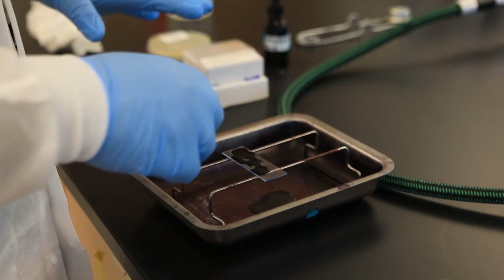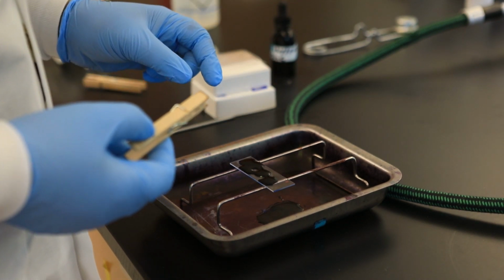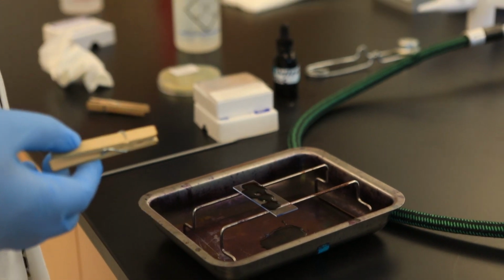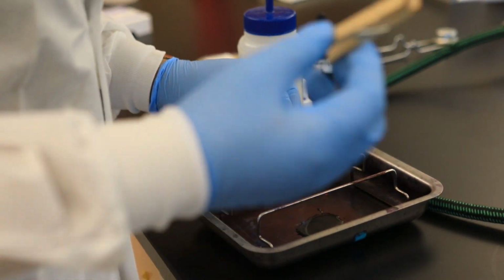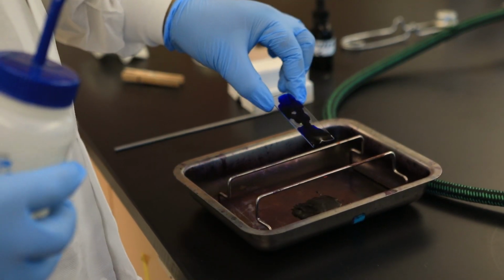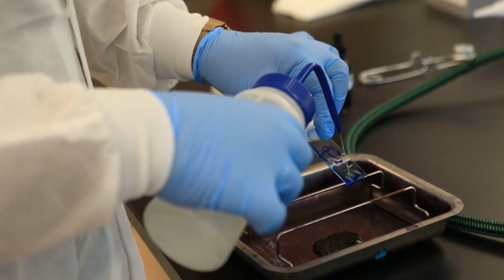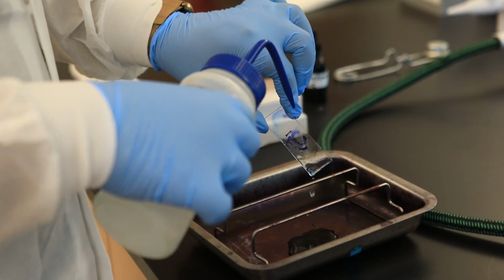So once the 60 seconds, or if you leave it on for 30 seconds, the time is up, what you're gonna do next is that you're gonna wash or rinse the slide. And you're gonna wash or rinse with distilled water, okay? The best way to do this, and usually I just do it with my hand, or you can use the clothespin, is that you angle it here, and then you do your rinse. And you're gonna get a sigh of relief when you see your smear is still there, and it's also stained.